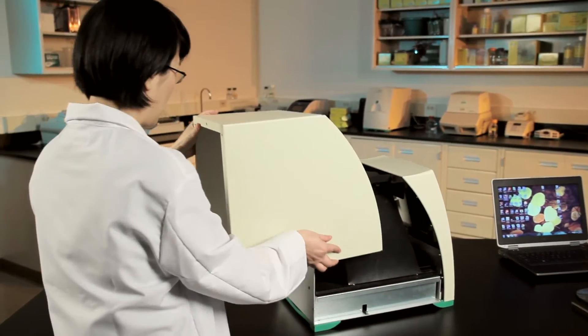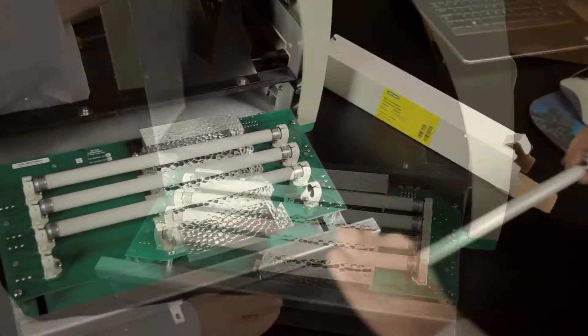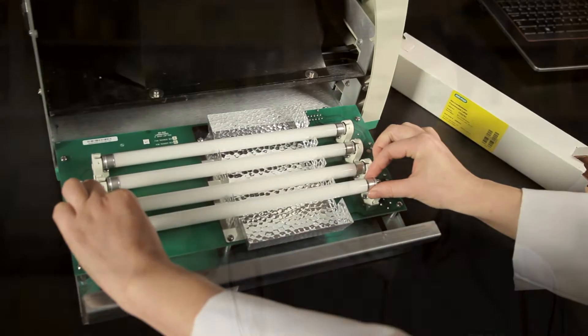When ImageLab software indicates that the UV lamps in the GelDoc EZ need to be replaced, the process of replacement is, well, easy.